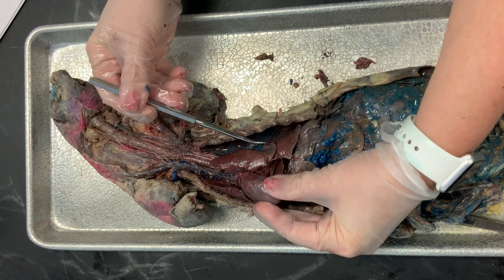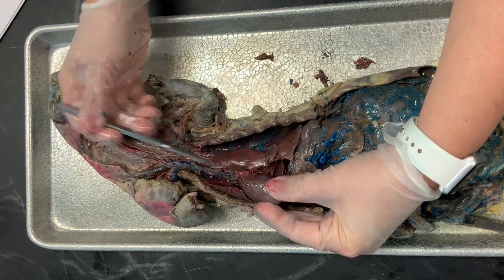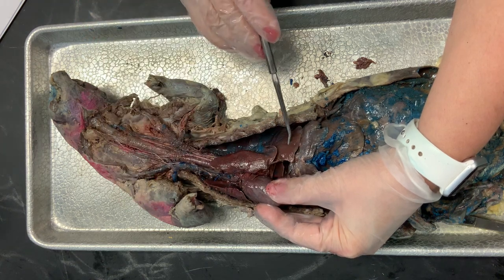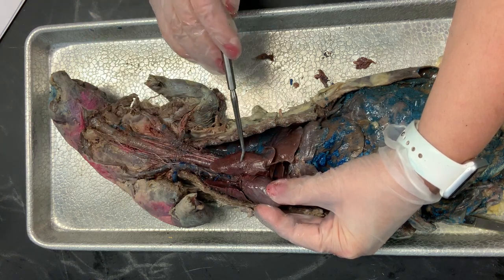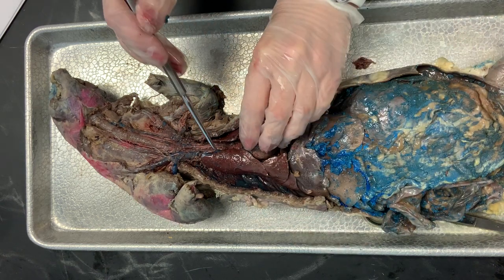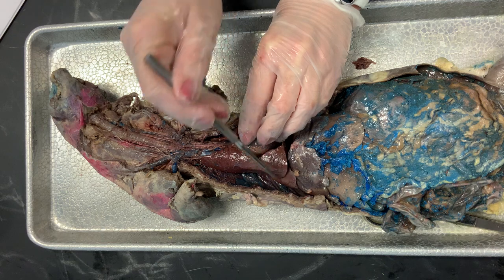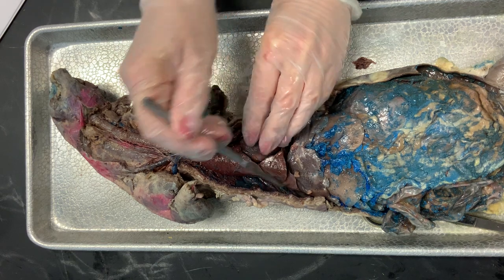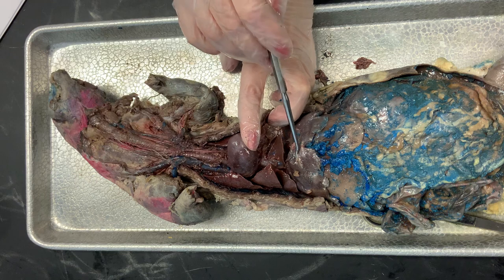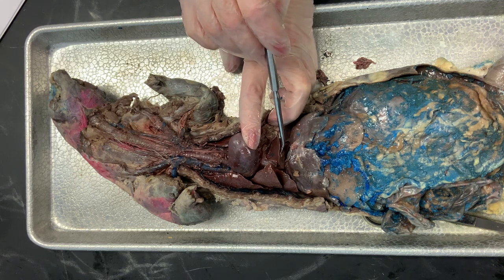On his left side there are only two lobes: a cranial lobe right here and a caudal lobe down at the bottom — left caudal lobe, left cranial lobe. Revisiting the right side: right cranial lobe, right medial lobe, right caudal lobe. And then under the heart, lifting it up just a bit, just above the diaphragm, we have the accessory lobe right here.